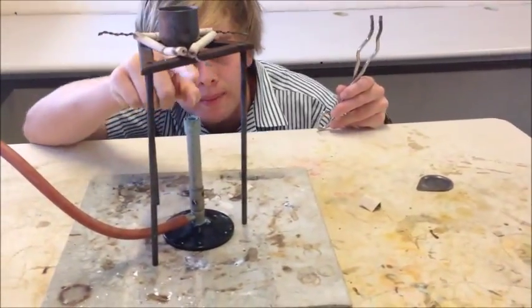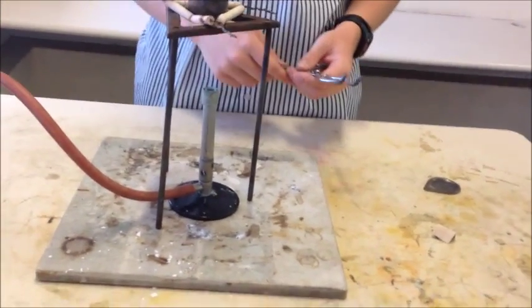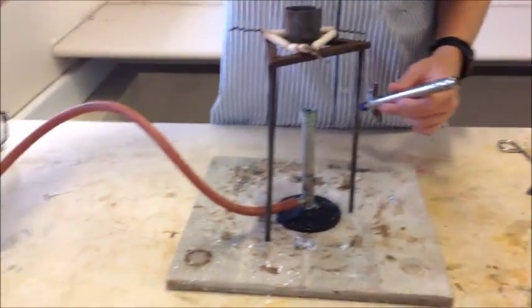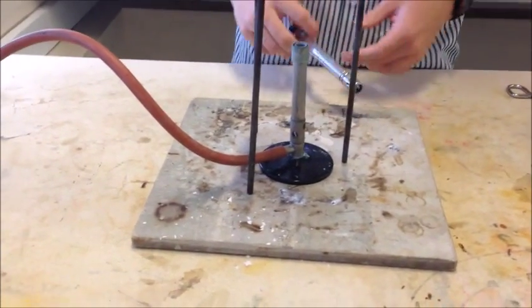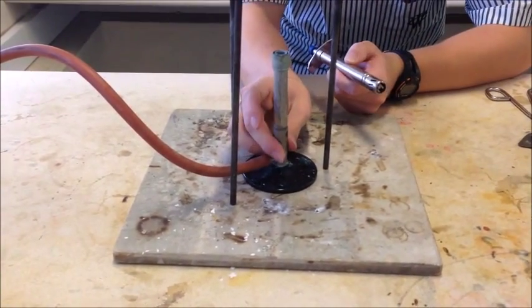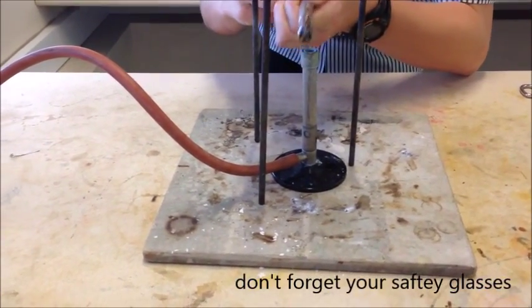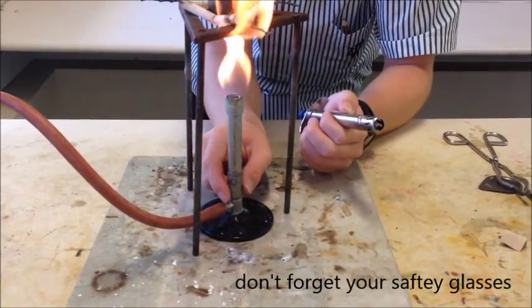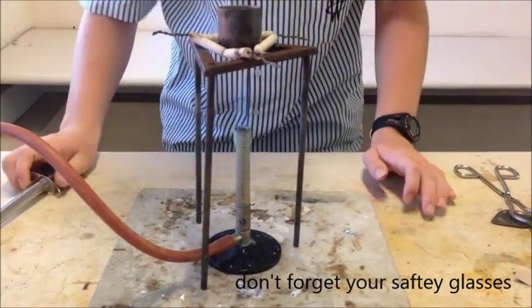Once you've placed it in there, you're going to want to make sure it's directly over the flame, and then grab something to ignite the flame. Once you find something to ignite the flame, you're going to want to turn on your gas and light the flame. Put it on your safety flame first so you can see when it's been ignited. Place the Bunsen burner underneath the pot and wait until a reaction starts to occur.